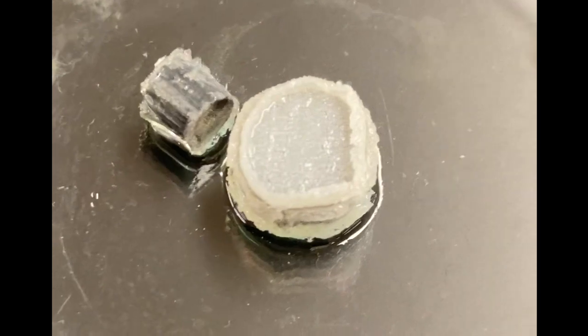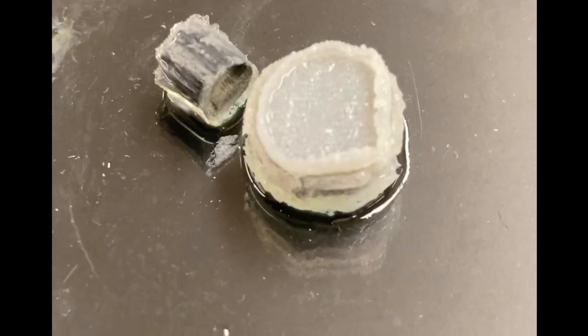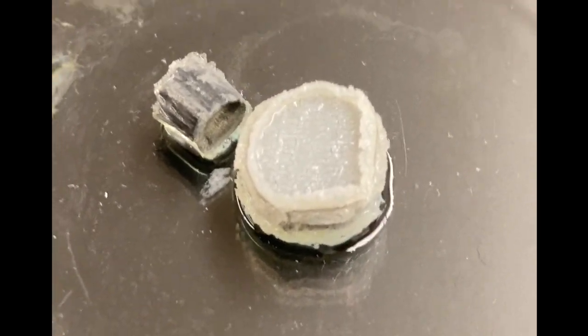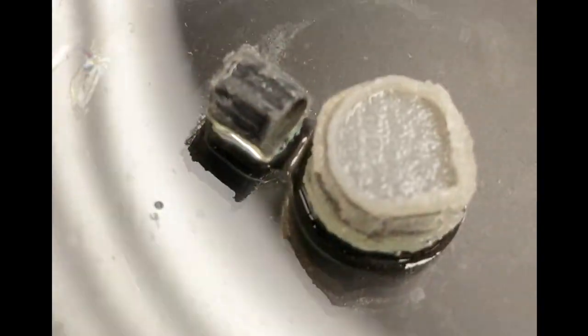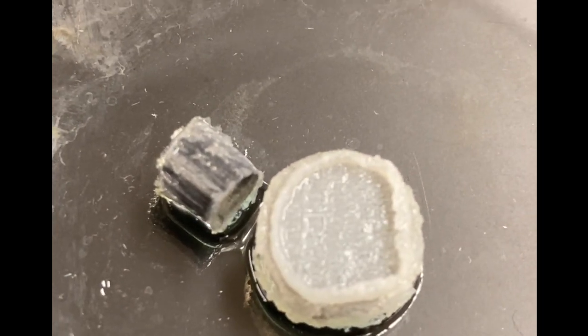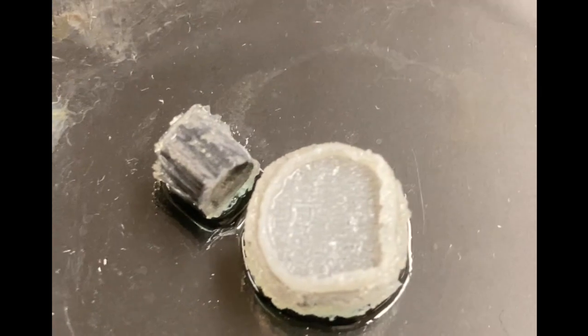This is lithium, also kind of oxidized. We actually store the lithium under oil because the air makes it do its version of rusting. You can see we have a small piece and a bigger piece, and we'll actually cut into those and show you what that looks like without the oxidation.